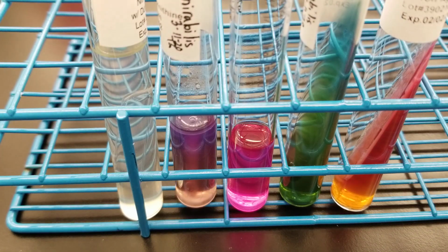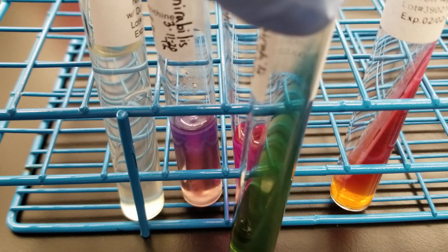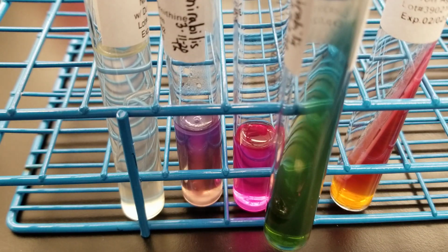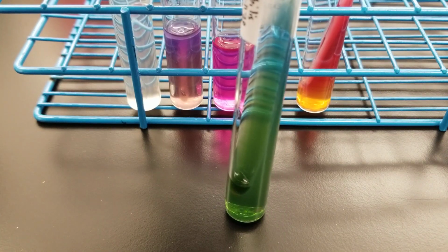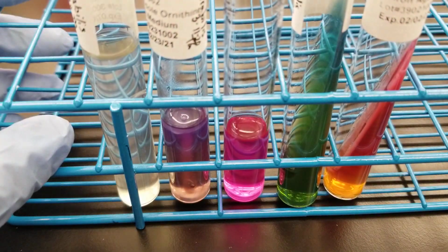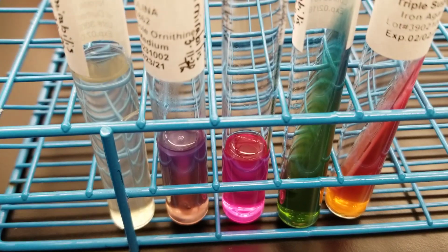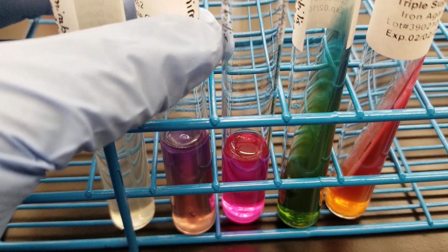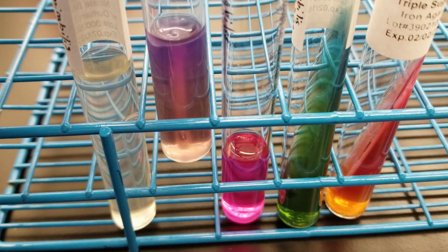And then with this organism, it is variable positive for citrate. So you see at the top here, there's blue at the top, but then it's green at the bottom, okay? So that's characteristic of the strain that we have. But again, it's supposed to be variable positive, so that matches. Then we have that beautiful hot pink urease, and it's supposed to be urease positive. For the MIO tube, it's supposed to be positive, negative, positive, and it looks like that so far.